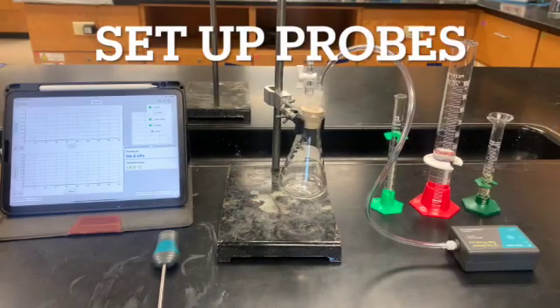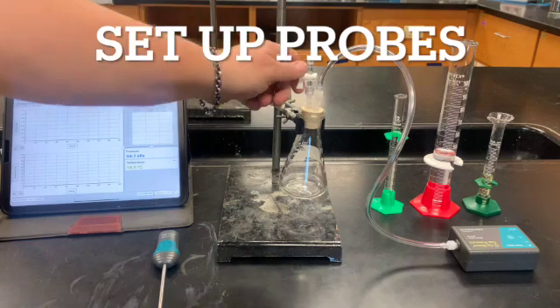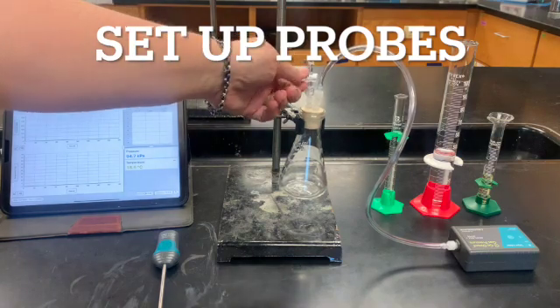Setup. Here are a few things. I'm going to set both my probes up. I have the wireless units here. I've got the gas probe and I've got the temperature probe. Okay, and that's ready to go. This is actually still open right now. That's going to be closed.